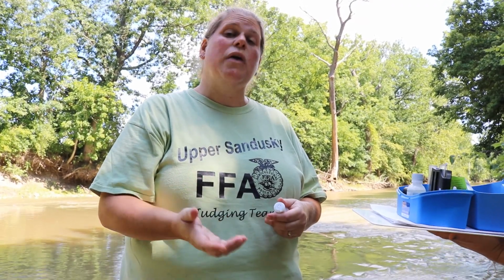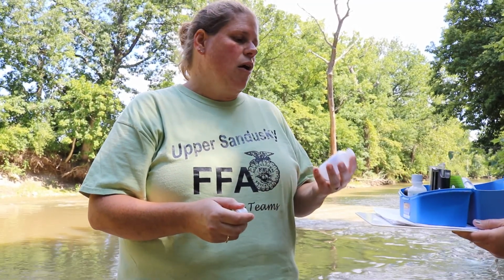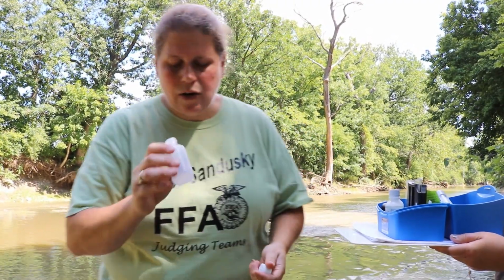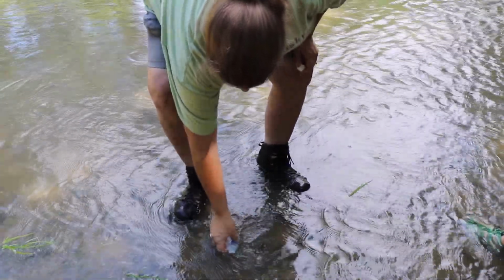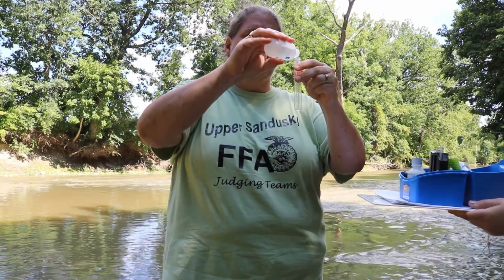Phosphate's the big one, because phosphorus is the most limiting nutrient in an aquatic ecosystem. And just a little bit of phosphorus will throw everything out of control and have all kinds of plant growth. But you also have to have nitrogen, or nitrates. And so I'm going to test your nitrates here with this system. So we're going to get our sample. You don't need a full bottle or anything specific with this. Just enough to grab a sample.